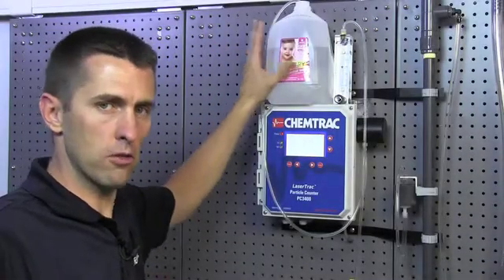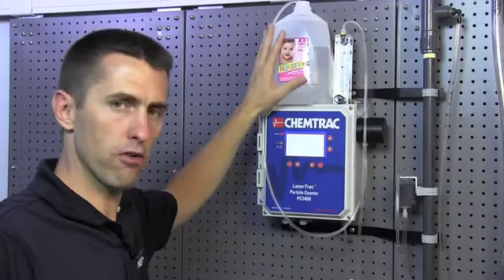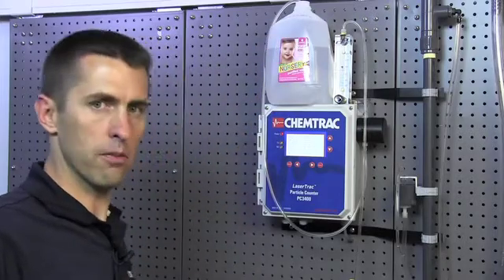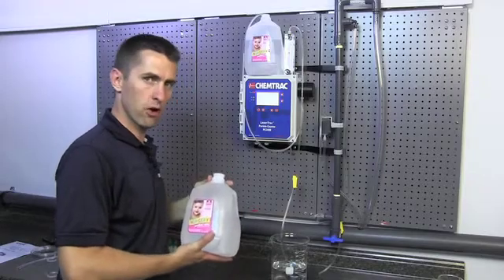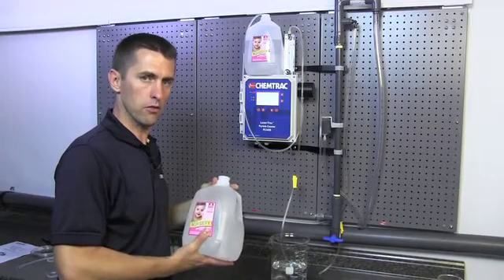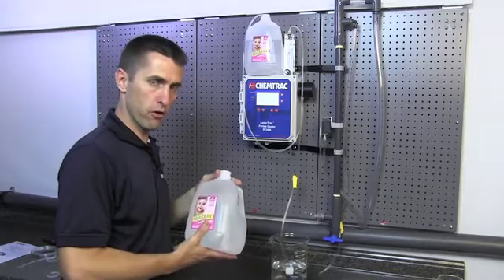The next step is we're going to replace the jug that we've been using to rinse out the system and then check our flow meter with the jug that we're going to use to make our first calibration solution. The first thing we need to do though is make sure that this jug has relatively low counts. So we need to measure it before we add the spheres first.